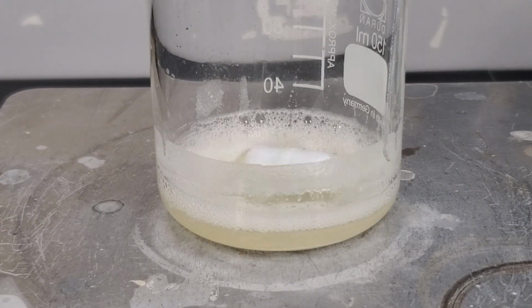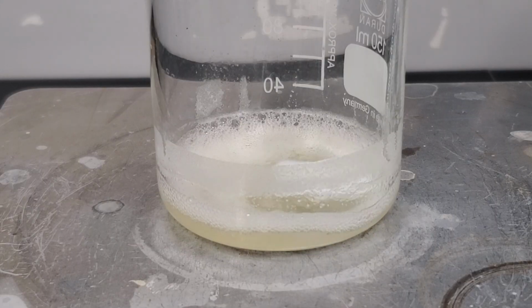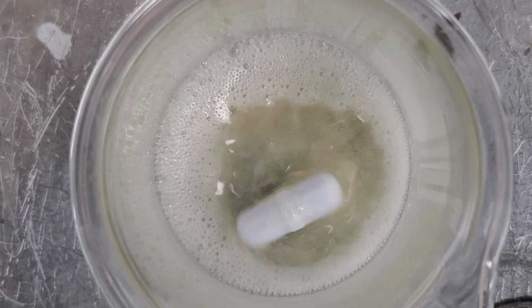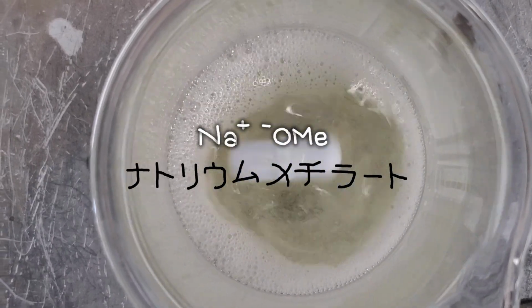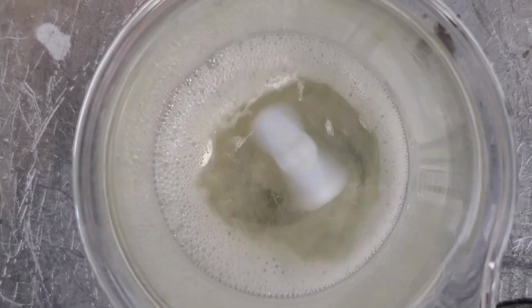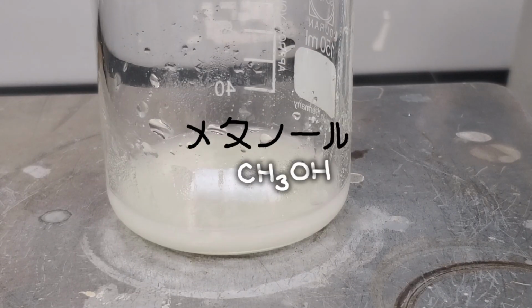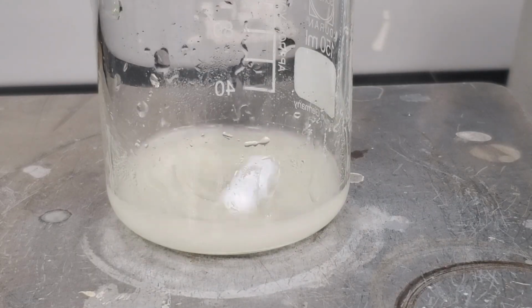Not all the sodium borodeuteride ends up reducing the aldehyde. Some is consumed by the solvent, so excess helps maximize conversion. A few pointers: adding a bit of sodium methoxide to the methanol can suppress borohydride decomposition by preforming methoxide. In the reaction, I also used cold methanol to further limit decomposition in methanol.